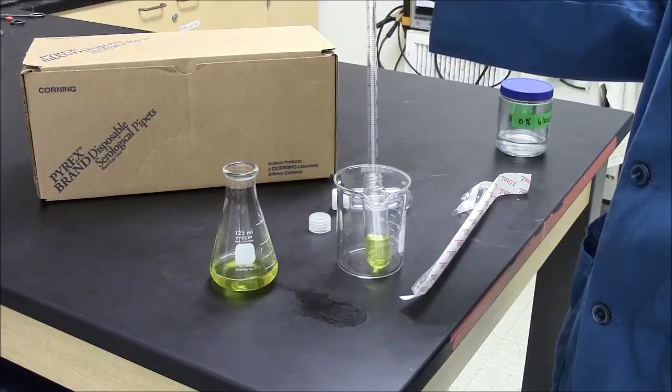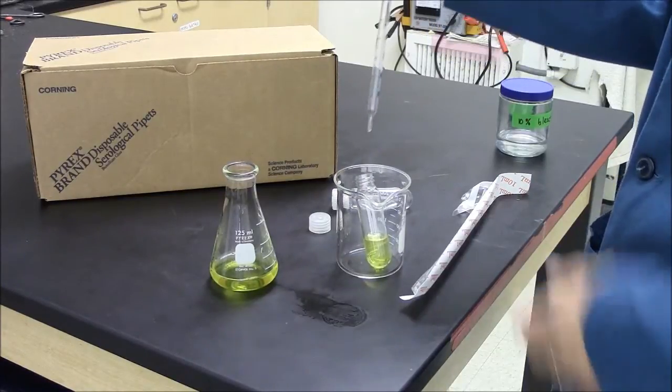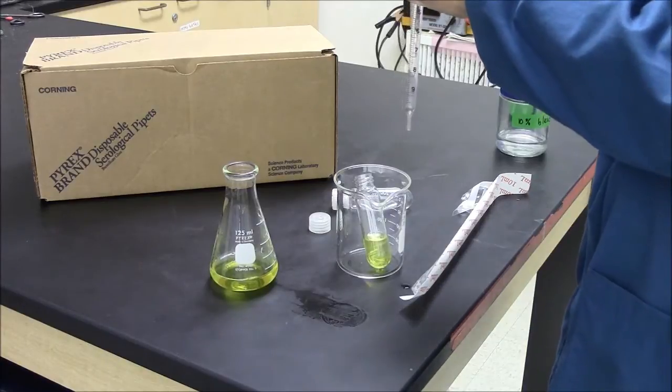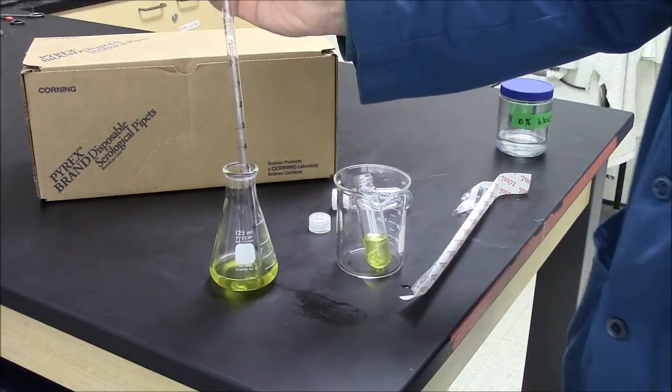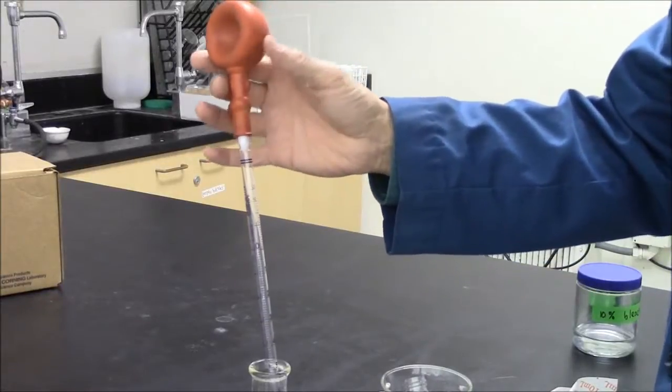What I'm working with here is actually mock broth. There's no bacteria in here. Yours will be cloudy from the bacterial growth. So if that's 10 milliliters, I'm going back to get another 10. I'm getting my second 10.